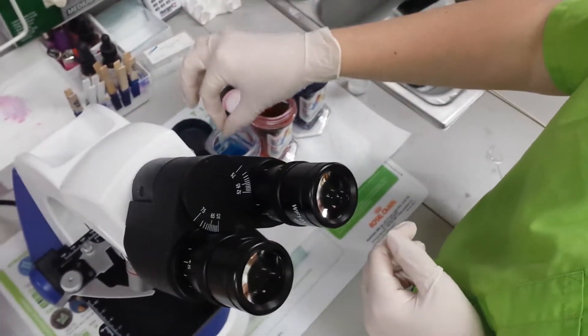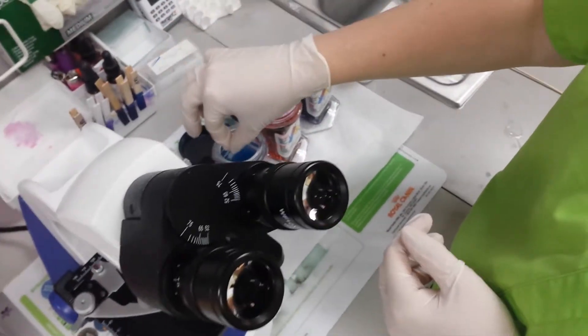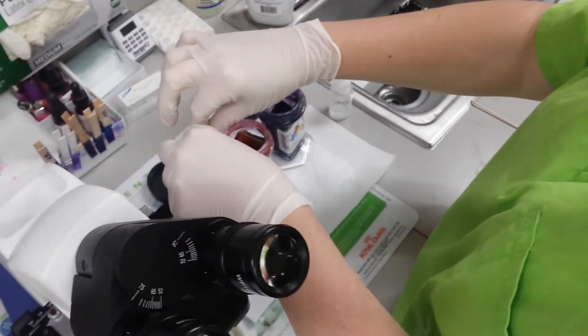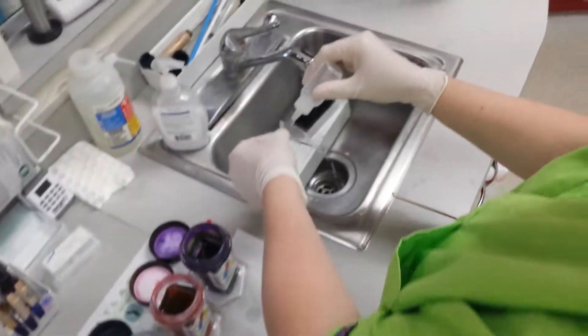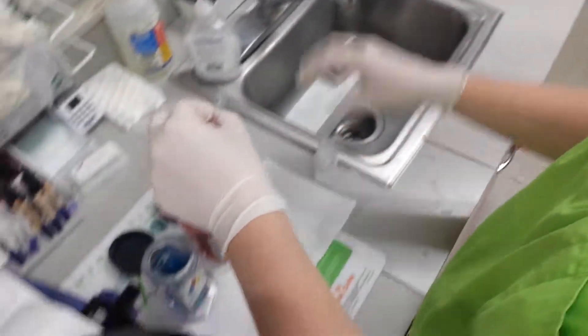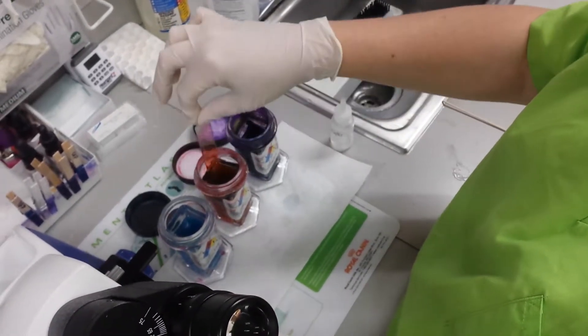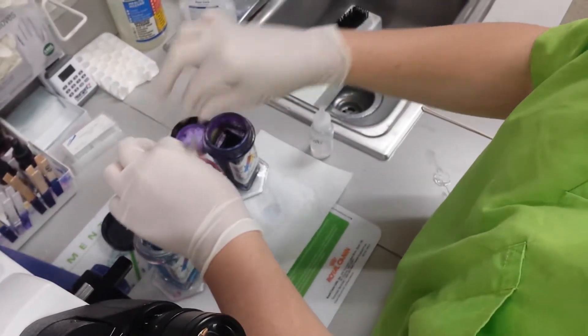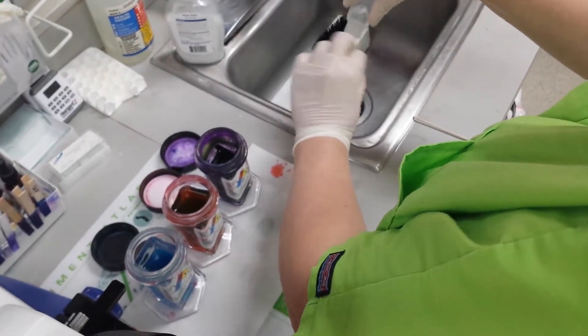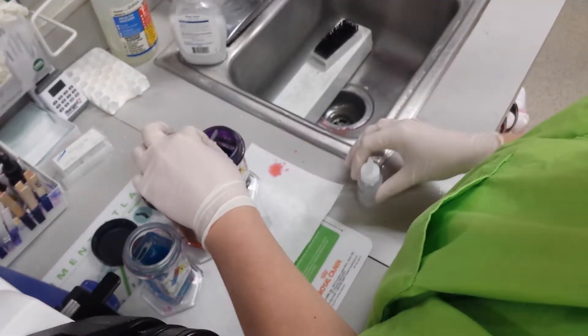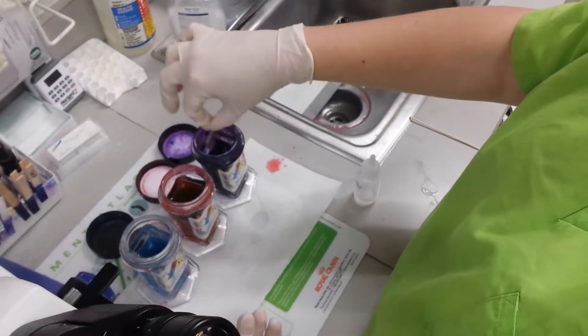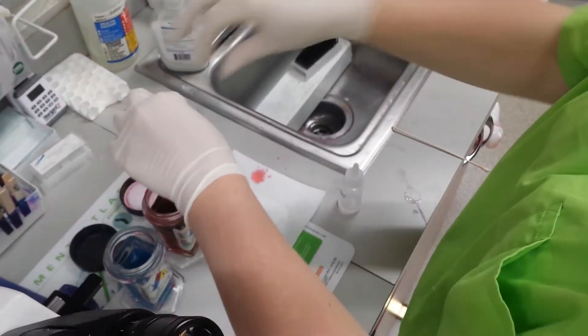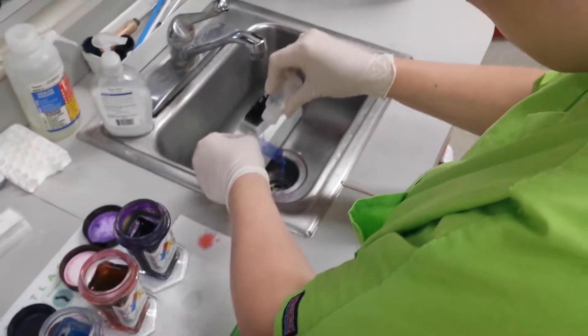Okay, so then we're just going to go ahead and do five quick one-second dips. We're going to make sure that we rinse our slide between each. We're going to rinse this one, five more.